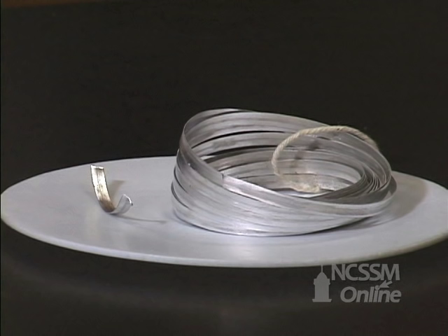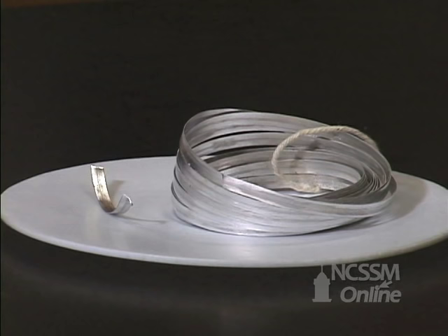One thing that's very apparent is the difference in how we store the metal. Magnesium is not stored under kerosene or mineral oil, it's stored out in the air. Even after being stored out in the air for months, the metal still has a very shiny surface.